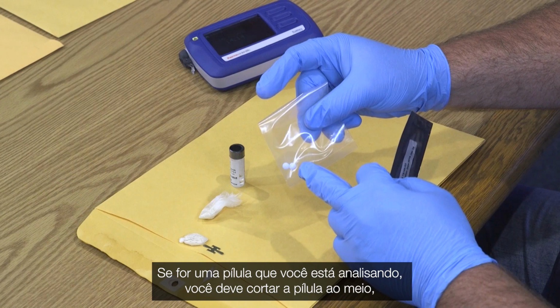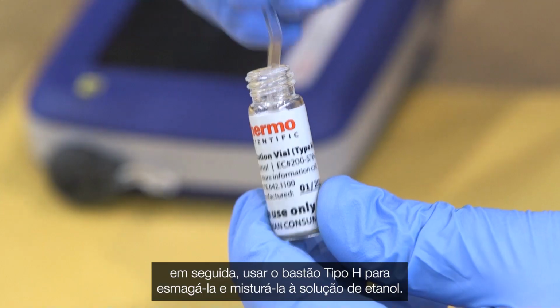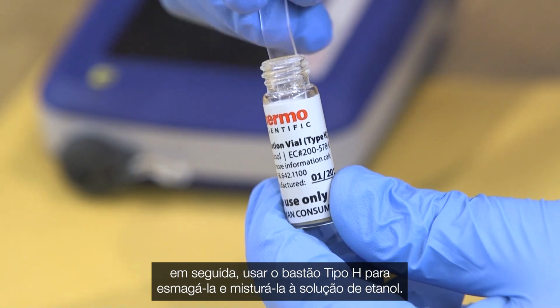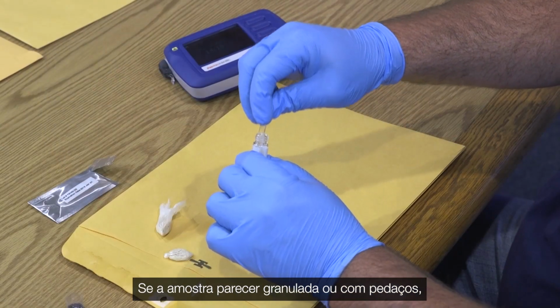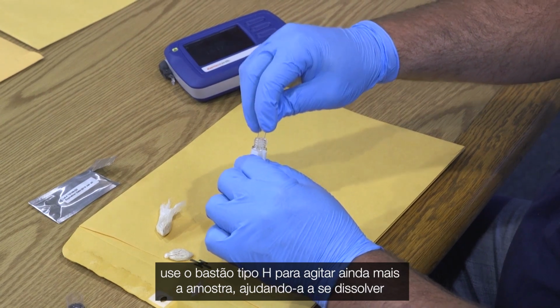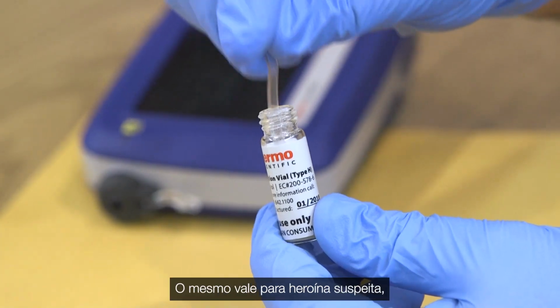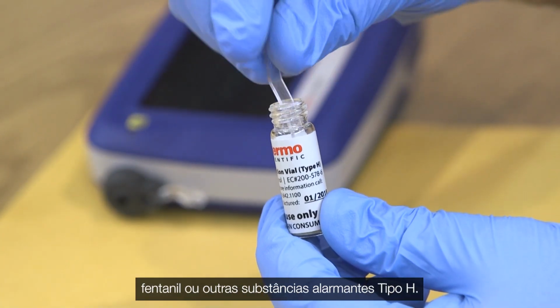If it is a pill you are analyzing, you should cut the pill in half, drop it in the ethanol, then use the Type H stick to crush it up and mix into the ethanol solution. If the sample appears to be grainy or chunky, use the Type H stick to further agitate the sample, helping it to dissolve inside the ethanol. The same would hold true for suspected heroin, fentanyl, or other Type H alarm substances.